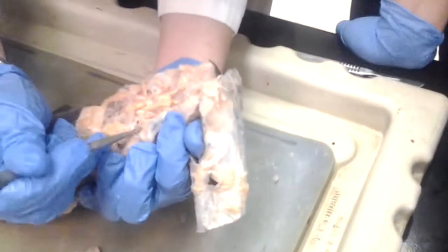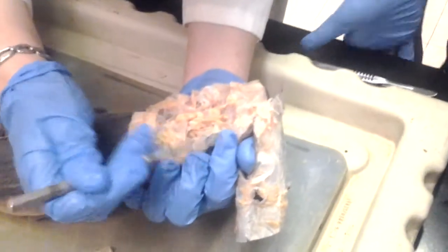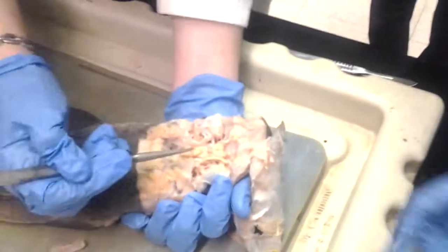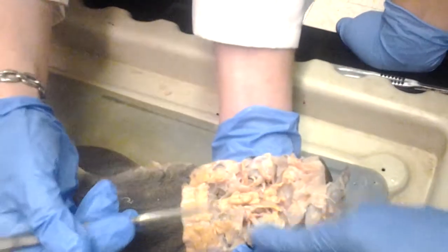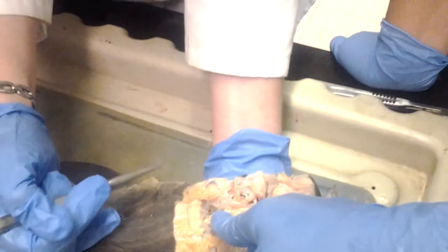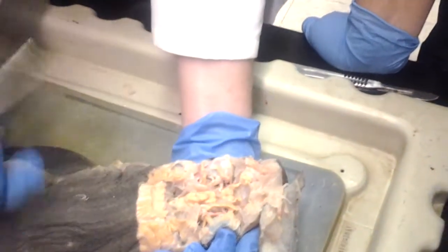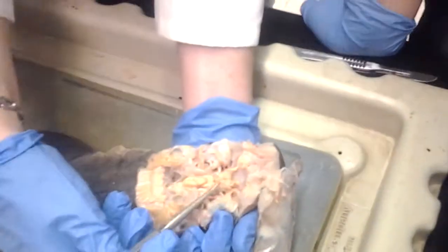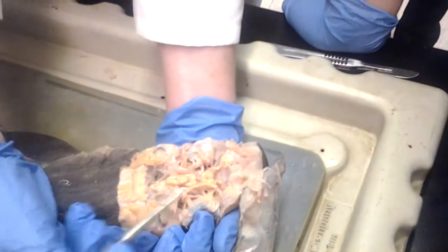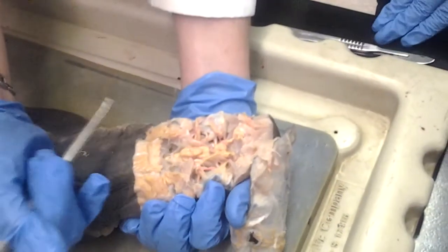Now, can we find the lateral rectus? Let's see. It comes from the brain. It's part of the 5, 7, 8 trunk. Doesn't it come from the cerebellum? Well, it doesn't come from the cerebellum itself, but it comes from the brain stem, right under the cerebellum. Oh, okay. So it's actually 5 and 7, trigeminal and facial. Should we name it ophthalmic?